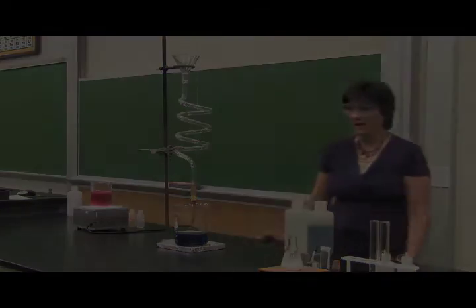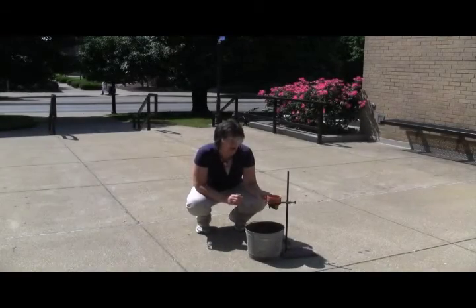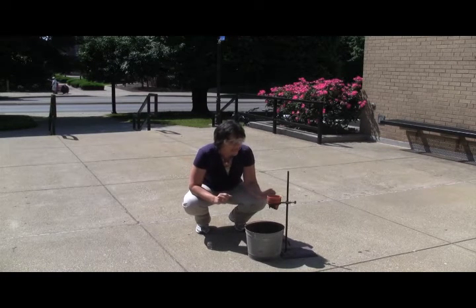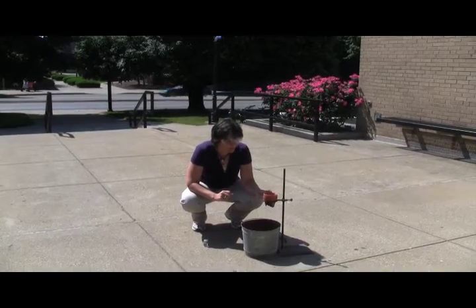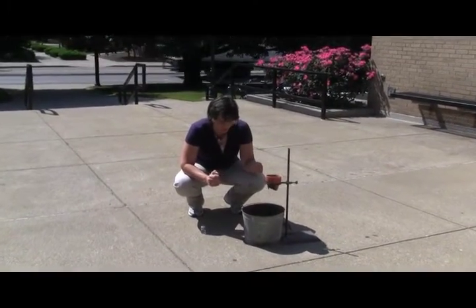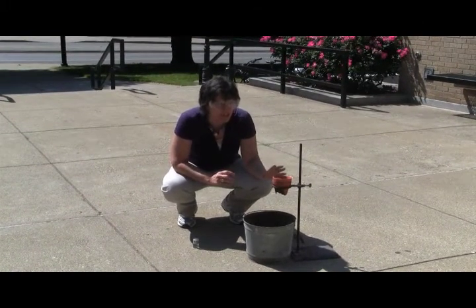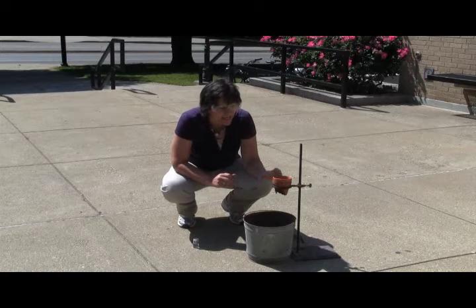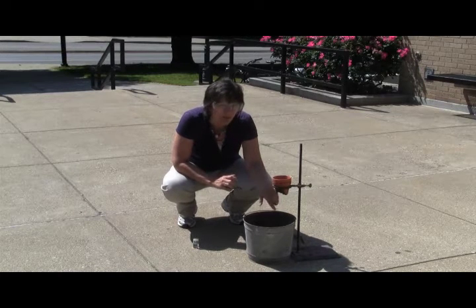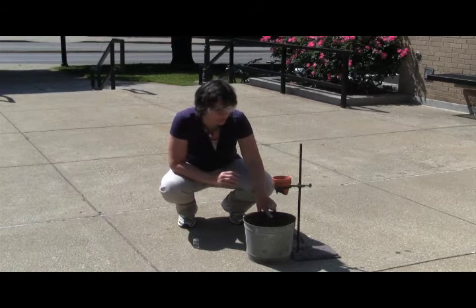Okay, now inside of this flower pot is a mixture of powdered aluminum. So imagine aluminum foil ground up into a little powder, and iron oxide, which is basically rust. And so they're just in powder form. This reaction will take place, and it's a pretty intense reaction, and it gives off a lot of heat. It produces so much heat that what will pour out of the bottom of this flower pot is molten iron. And so I've got a sand bucket here to catch that molten iron.